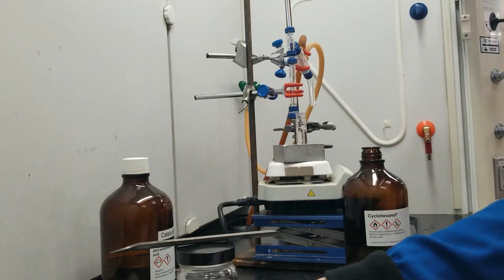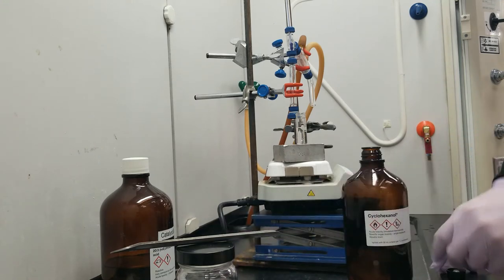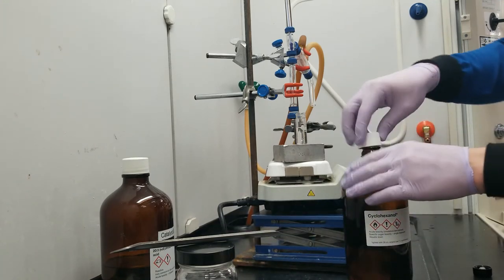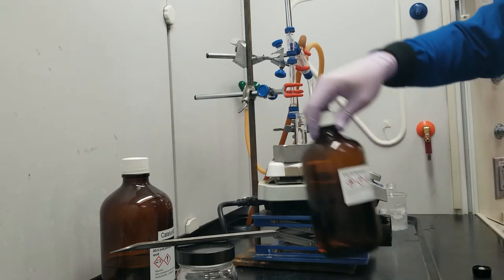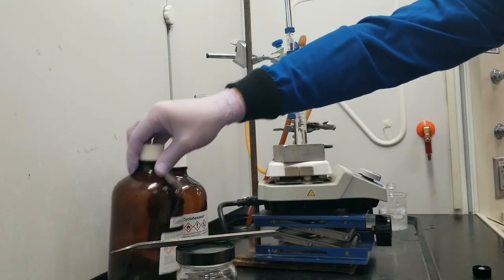And then I'm going to add in my catalyst solution the same way and I need a half milliliter of that.